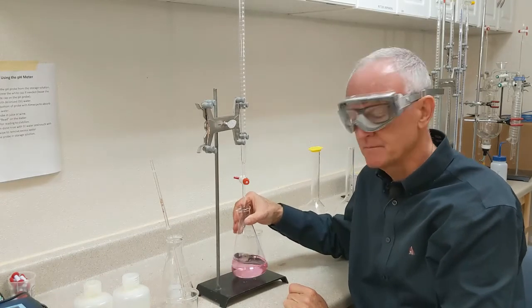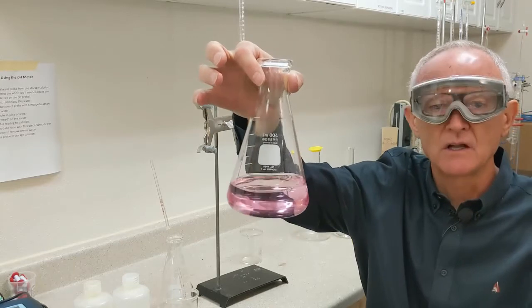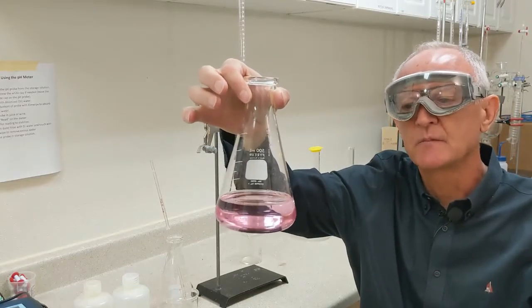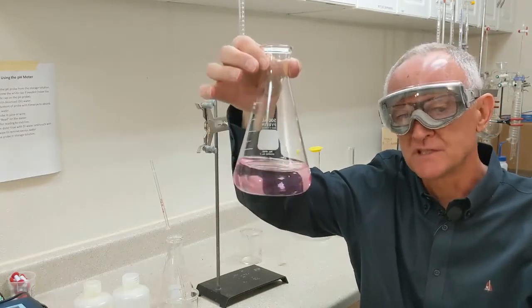Yep, that's it. So that's the kind of pale pink color that you want. Not that bright color we had before. But something about like that. Next, I'm going to read the ending volume of sodium hydroxide.